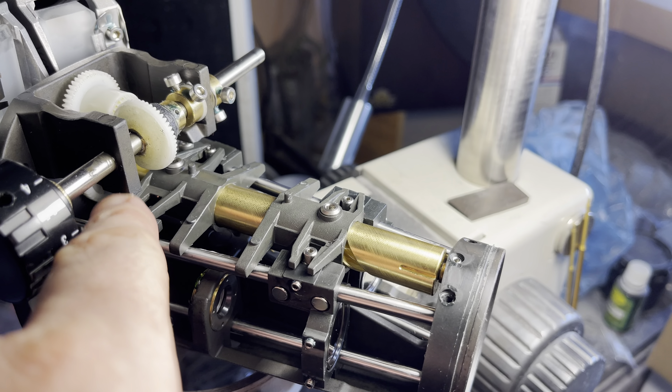Looking at the schematic, we see two protective glasses. These are made in an interesting way — they are orthogonal, meaning totally 90 degrees aligned to the incoming light. This has some benefits, but also a drawback: we have a more-or-less constant reflection, especially in low magnification modes, and we cannot get rid of those reflections at all because they are always in the center of the frame.